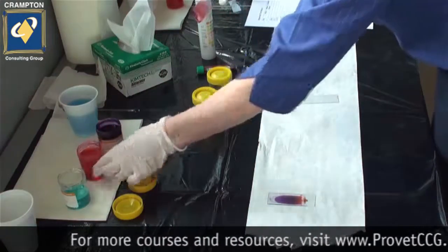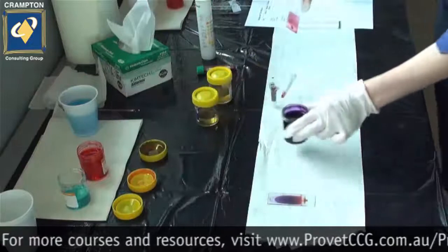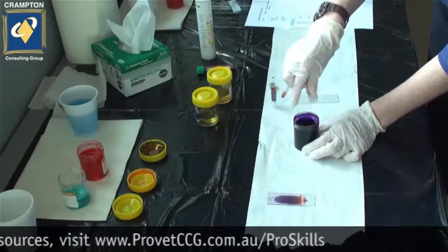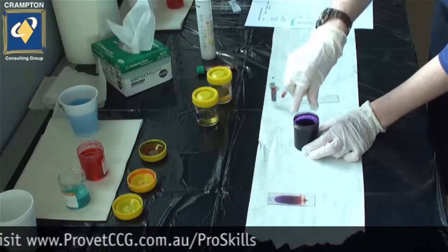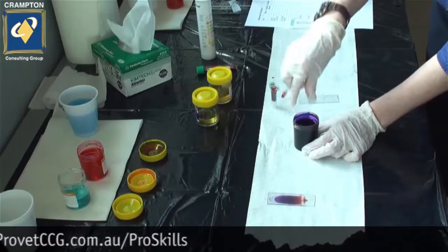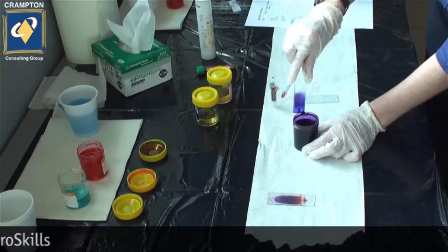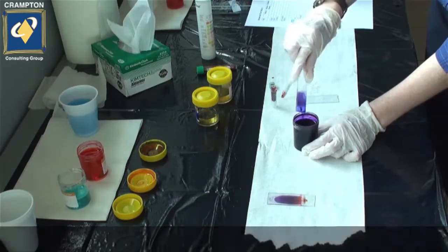Tap off your excess, and then dip into the third stain. Again, ensuring that all of the sample has been adequately covered.